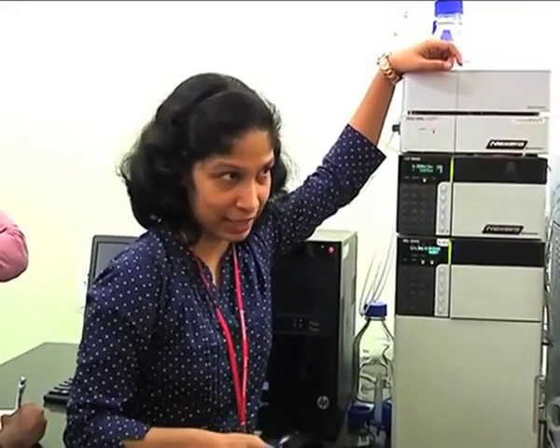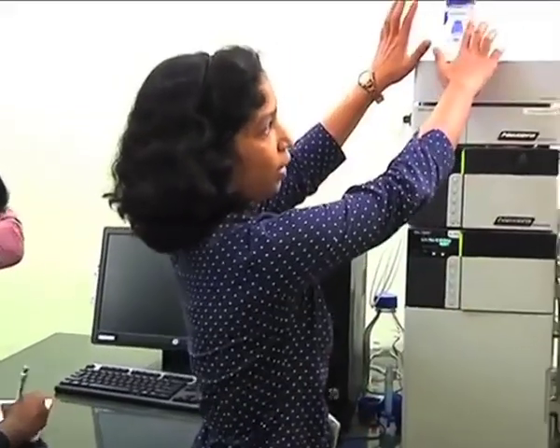There are two types of configurations of HPLC available. One is called a high pressure binary gradient system, and one is called a low pressure quaternary gradient system. High pressure binary gradient system means if you have two mobile phase ports, then there will be two pumping units, one for each of the mobile phase ports. That becomes high pressure binary, and binary because there are two.